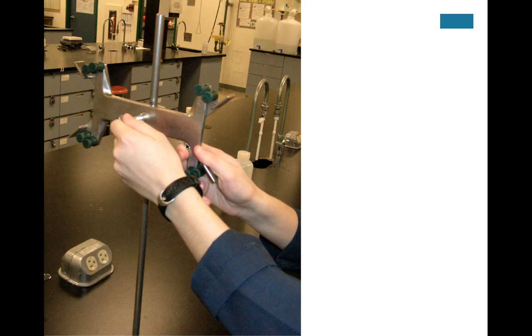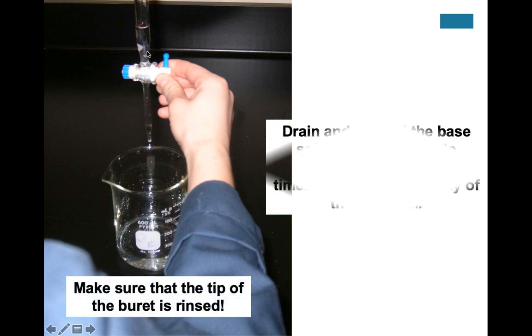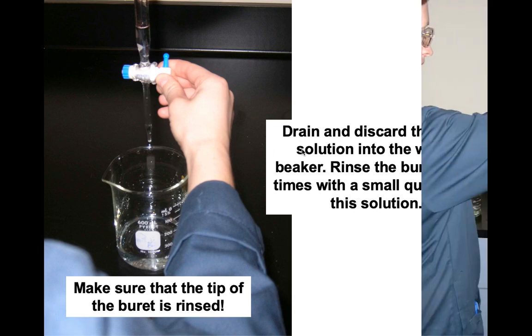And now we're going to clamp a burette clamp to the ring stand. And then we're going to clamp the burette into the burette stand just to make sure it's there. And then what we're going to do is fill it up a couple of times with a small amount of base. So we're going to rinse it with maybe 5 milliliters of base just to make sure that after we clean the burette, the burette has the concentration of the base that we want. And we also make sure that the tip is rinsed too.